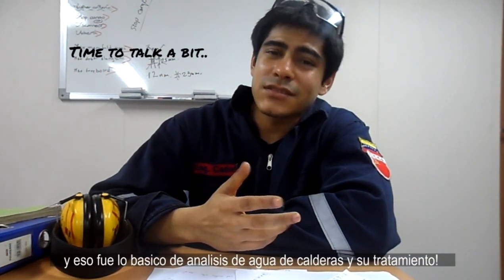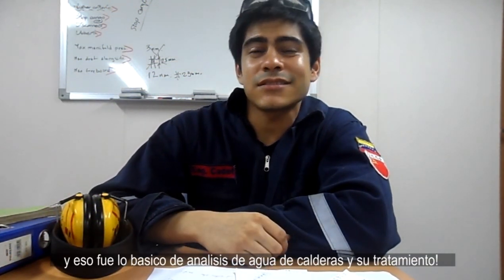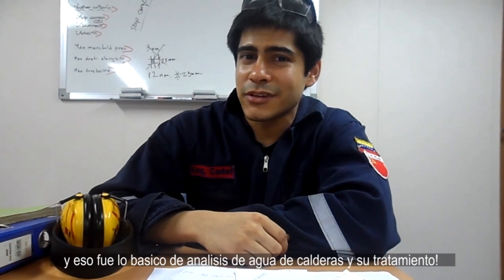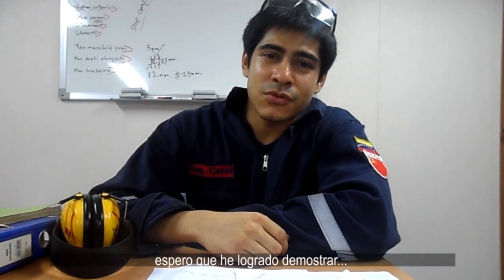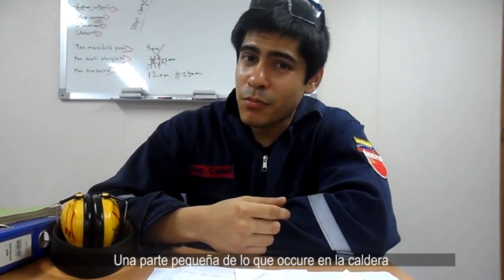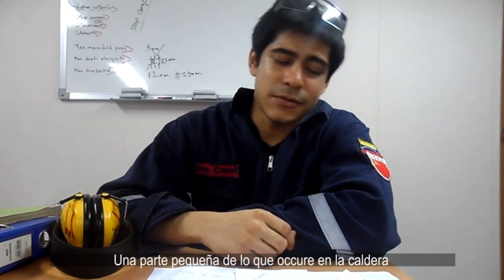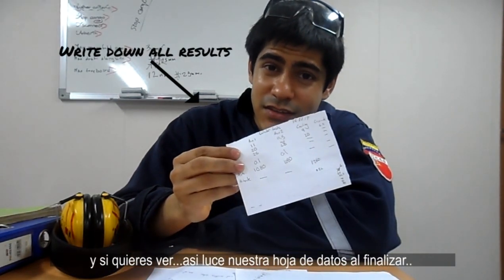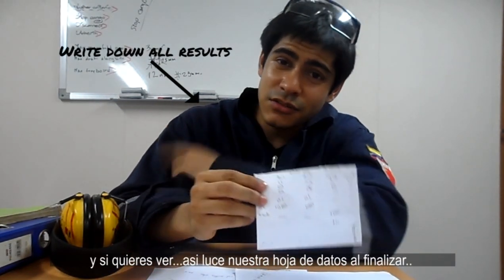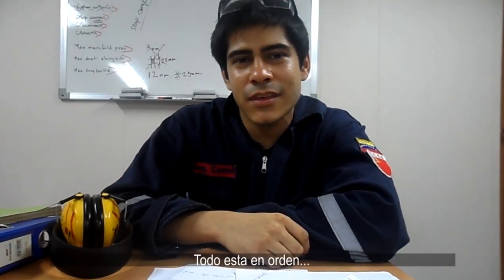And that's the basics of boiler water testing and treatment. Hopefully this has shown a small part of what's going on in the boiler. Here is how our data sheet looks in the end — everything's in order.